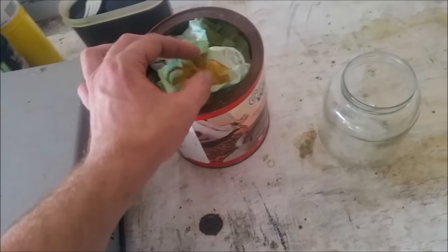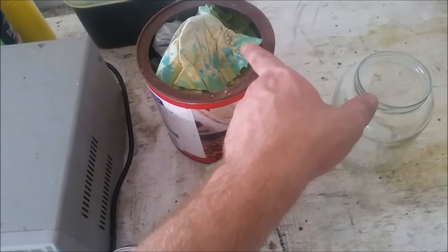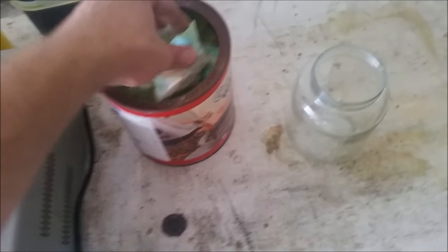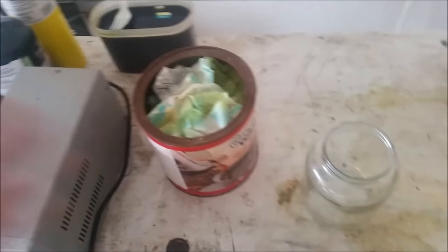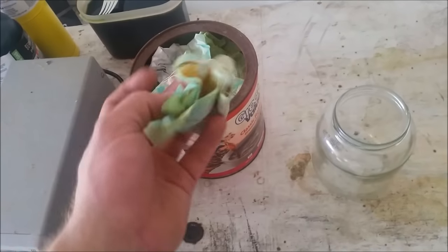Metals that are not copper will inevitably fall out of solution when you're doing so. As you can see, there's still a lot of copper sulfate crusted all along these filters. It's just simply come time to where this can is full of filters and ready for me to start processing. The first thing we need to do is get rid of the copper sulfate that is still on here because it's very water soluble.